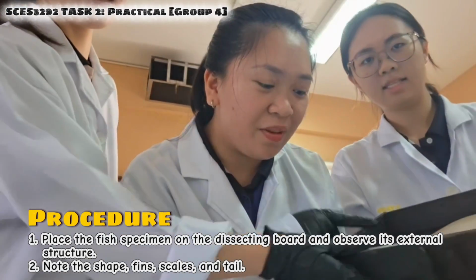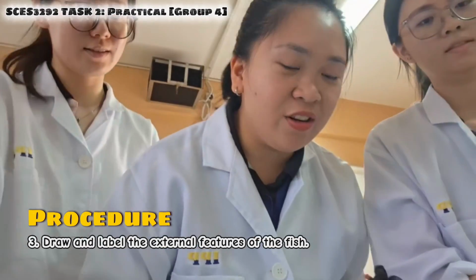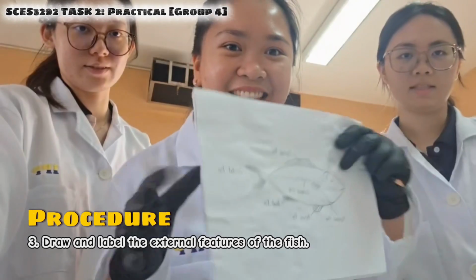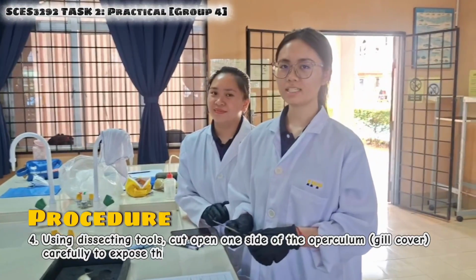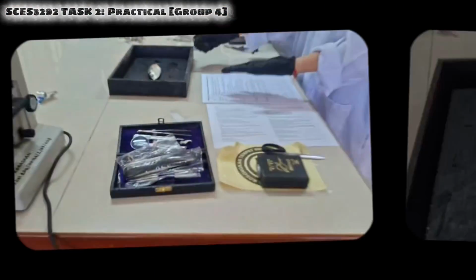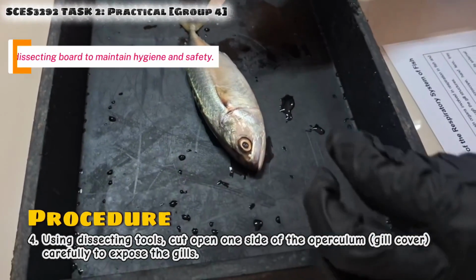Note the shape, fin, scales, and tail. And then we're going to draw and label the external features of the fish like this. Now we are going to start the dissecting process using the dissecting tool. So now I'm going to cut open the side of the operculum to expose the gills.